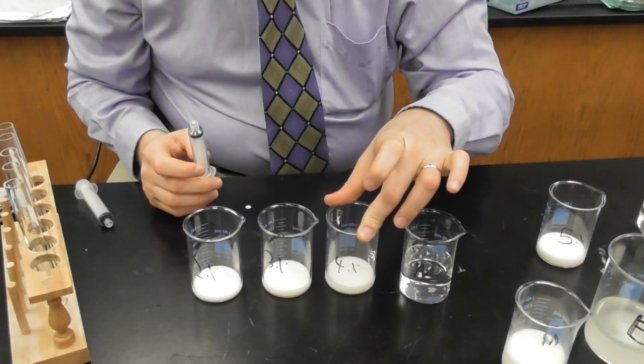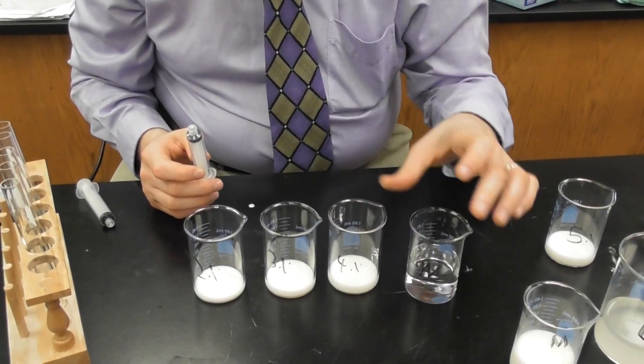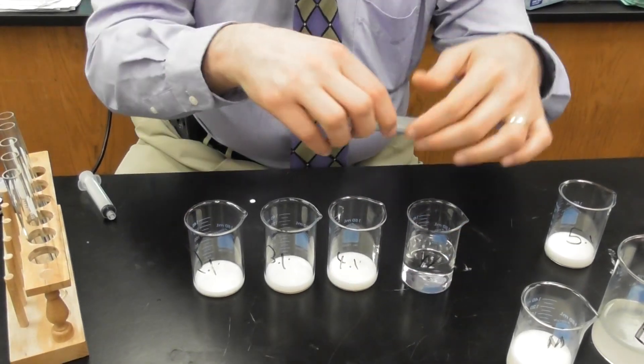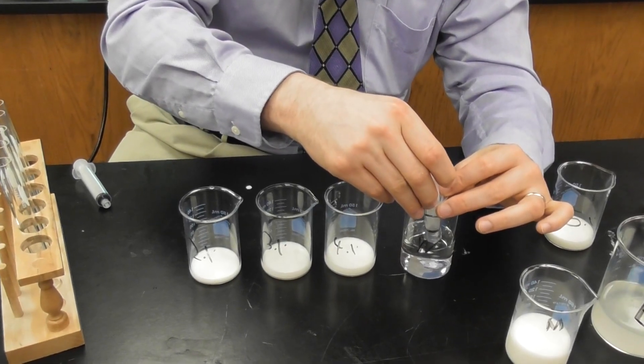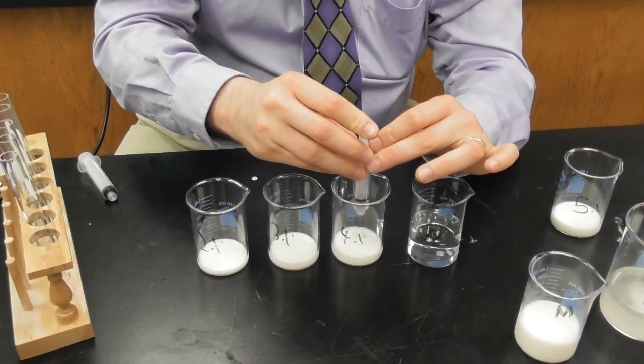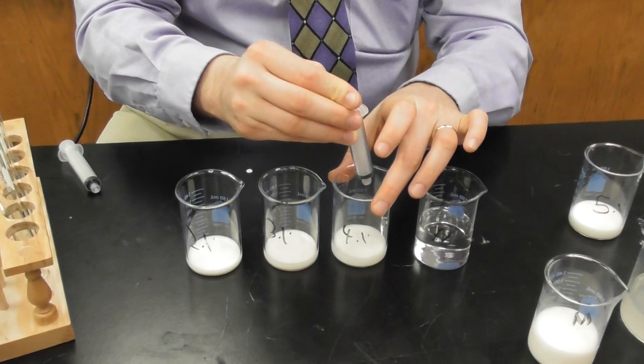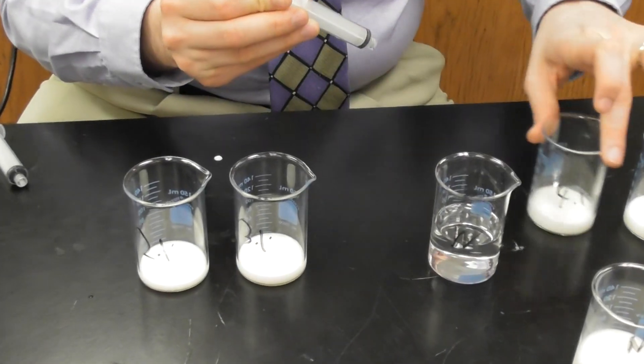Now for my 4%, I put in 16 and I need 4 to be the remaining 4. I need 4 to fill to the remaining 20. So I'm going to add 4 to the 4% to fill to the remaining 20. And now it's at 20.